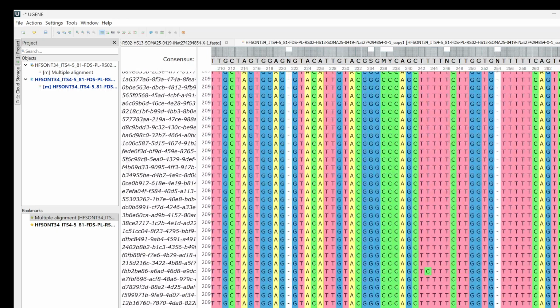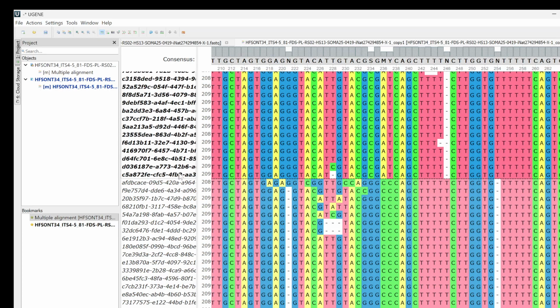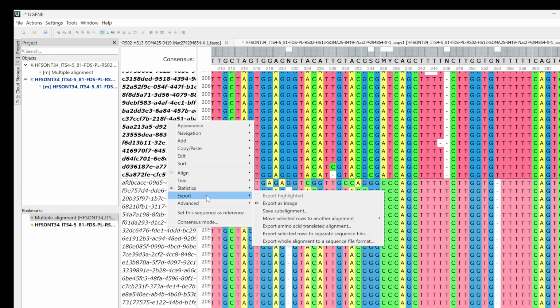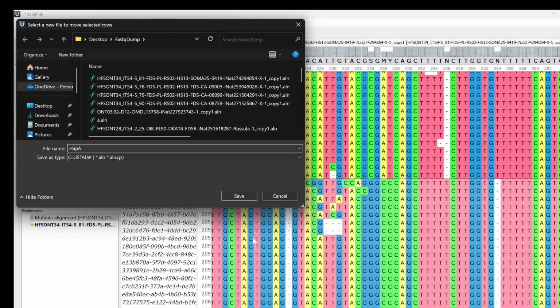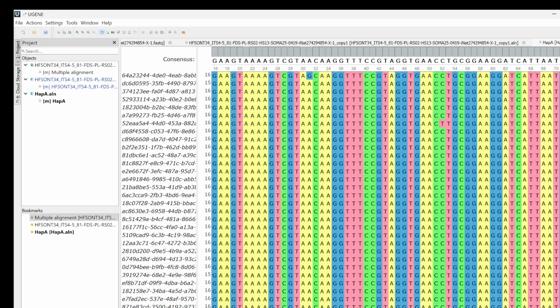So I'm going to break up these two chunks of sequences, and the way I'm going to do that is, notice I selected the top one. I'm going to hold the Shift button and I'm going to click there, and that selects that top chunk, and then I'm going to right click, and what am I going to do? I'm going to do export and move selected rows to another alignment, create new alignment. And I'm just going to name this Hap A. That's going to take them away and move them to a new alignment. And then this one is going to be our haplotype B.